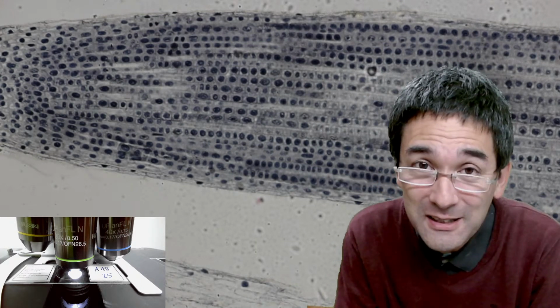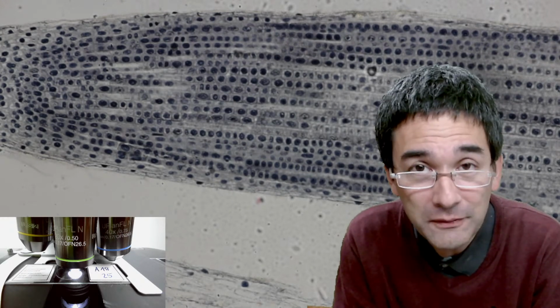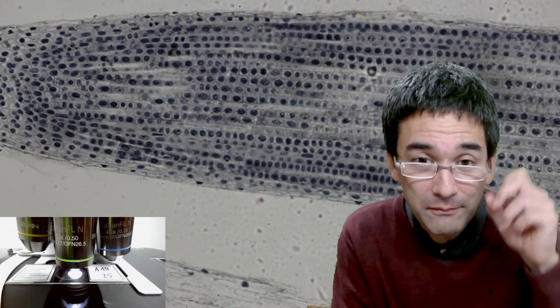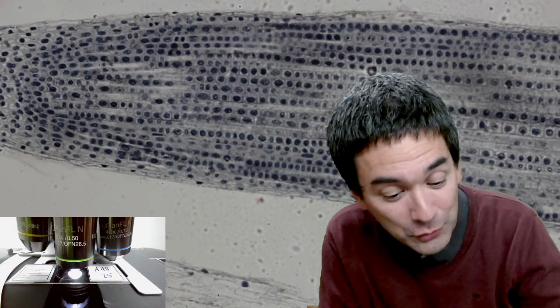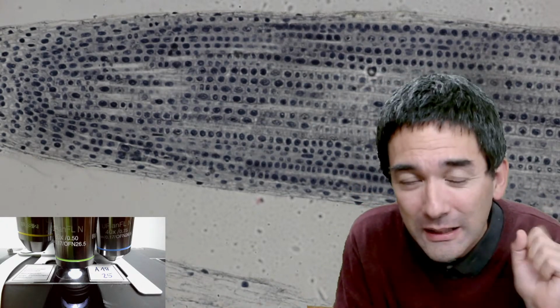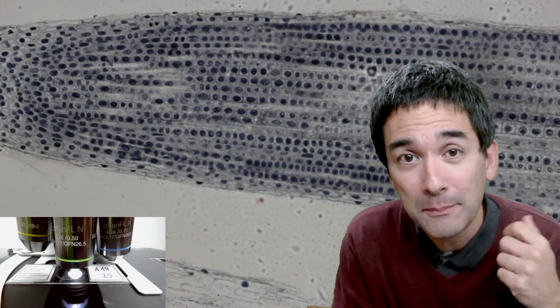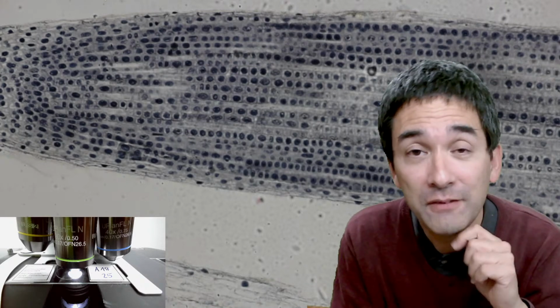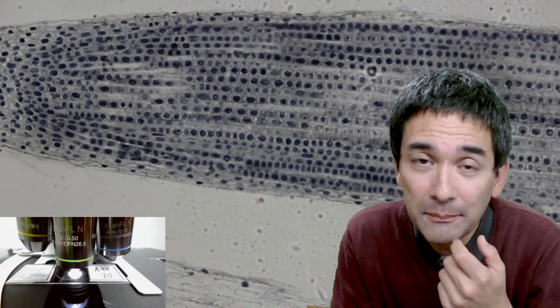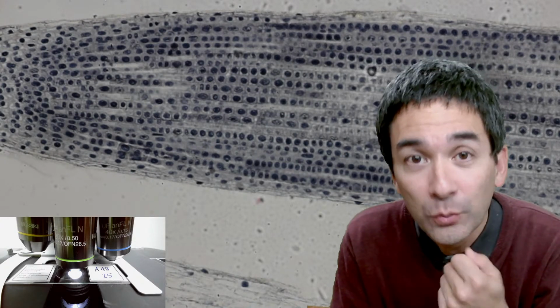Before I start, I want to tell you something very briefly. Microscopy is, of course, a nice hobby, but it does occasionally have one slight disadvantage, and that is that sometimes when you buy prepared microscope slides, like the one that I have here in the back, it can be a little bit abstract, and sometimes it is good to know a little bit of biological background in order to understand what you're seeing.